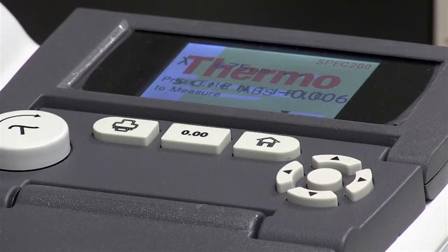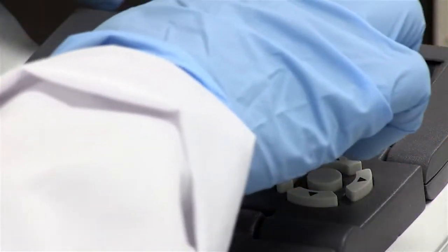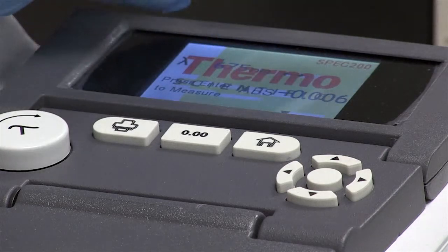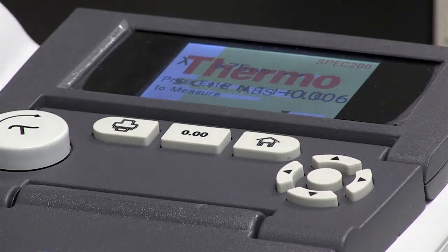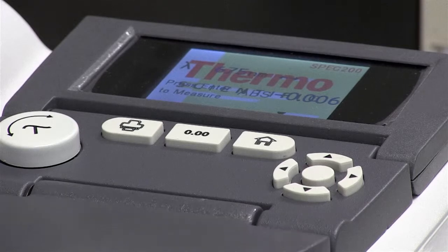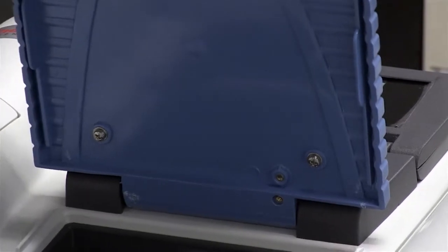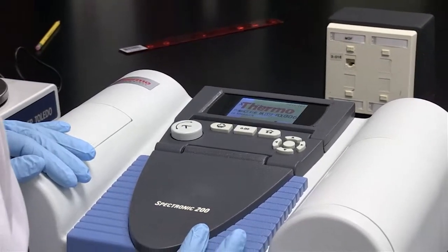One nice feature of the SPEC 200 is that it shows you where on the visible spectrum your substance is absorbing. Here it shows you're at 675 nanometers, which is in the red portion of the white light spectrum. Now that I've done my auto zero, I can switch my blank out and put my sample in to measure its absorbance.